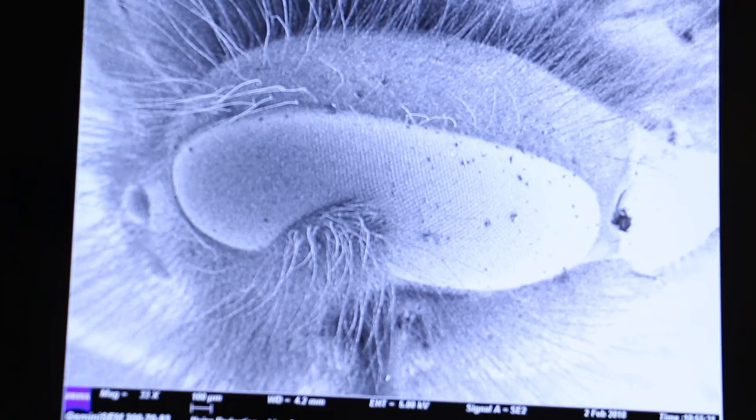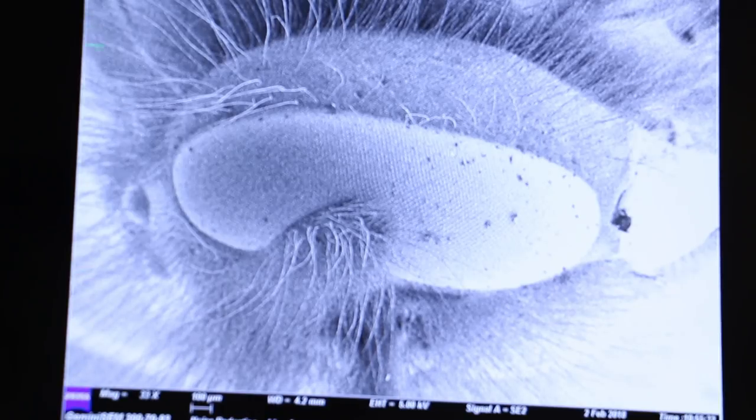I'm Lucy, a final year geology and petroleum geology student. I had the opportunity this summer, just after the SEM was bought, to use it in a Carnegie Vacation Scholarship internship. This is where I designed and built a thermal hot spring to grow rocks out of water, to see what happened to them when they're really, really hot.